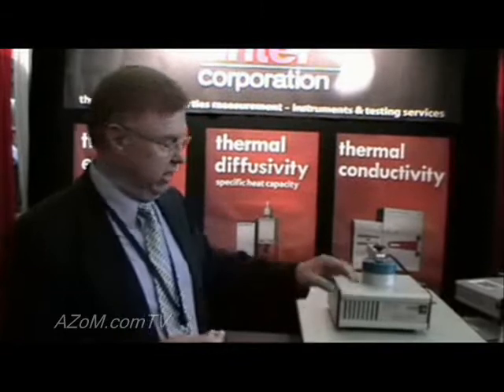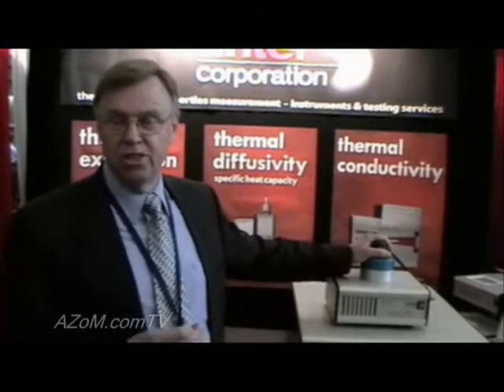By using a reference material side by side in a dual sample configuration, we can also measure specific heat. And then knowing density, we can calculate thermal conductivity for a wide range of materials.